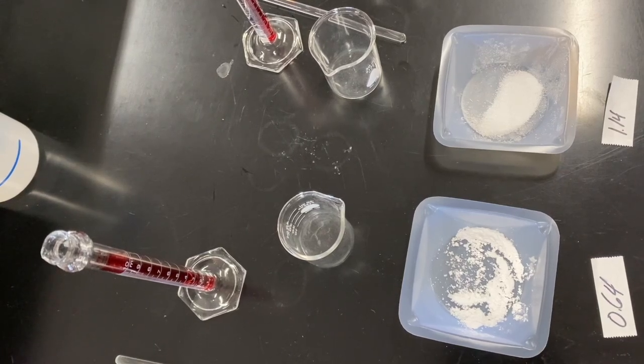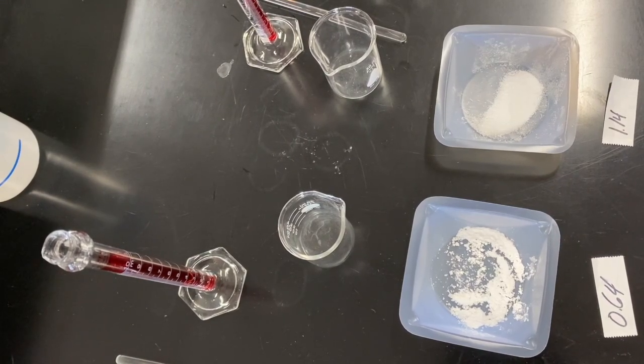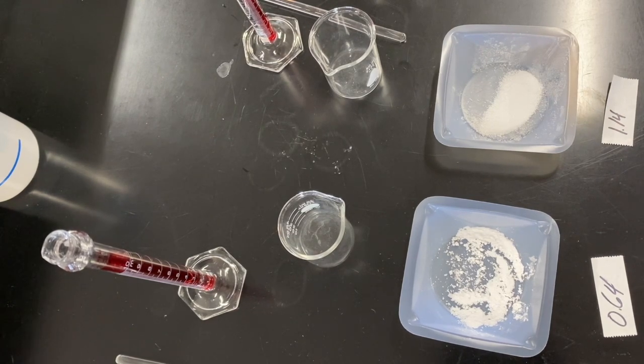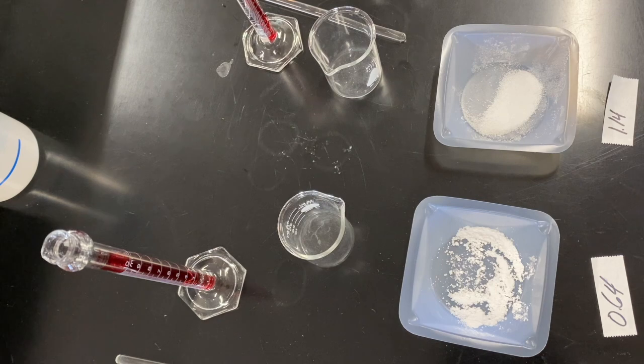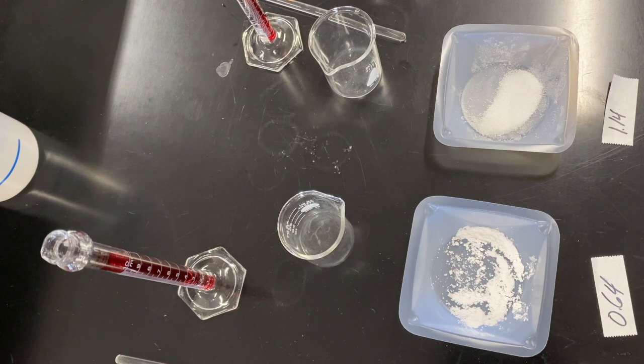Alright guys, this is the limiting reactant lab and this is going to take part in a couple of stages. If you were in class, we would try and get this all done in one class period. Seeing as how this is a recording, I'm going to actually allow some time in between the different stages to make sure that we collect everything that we can.